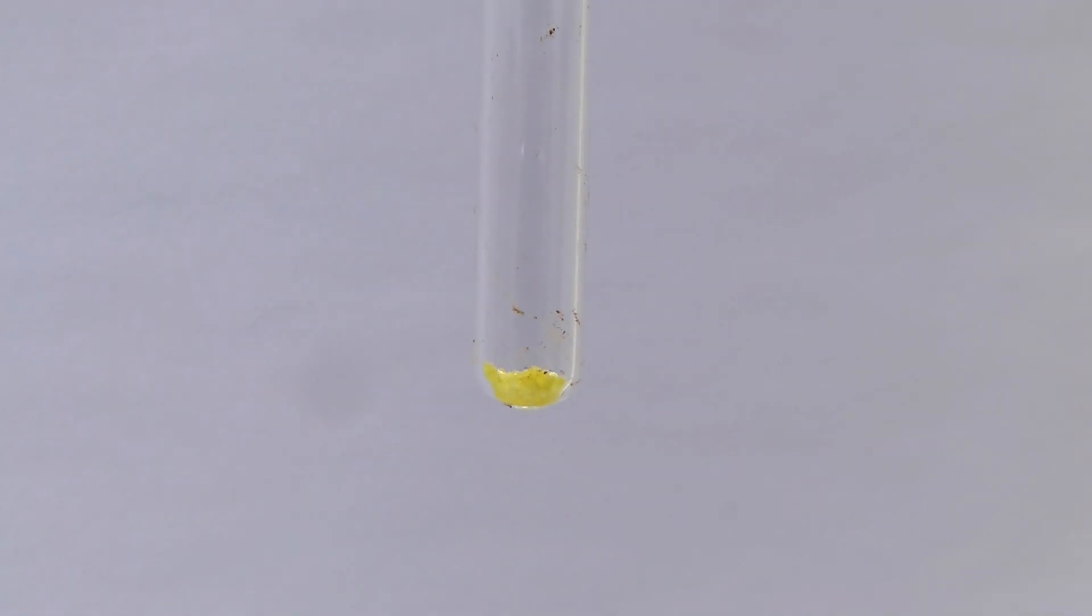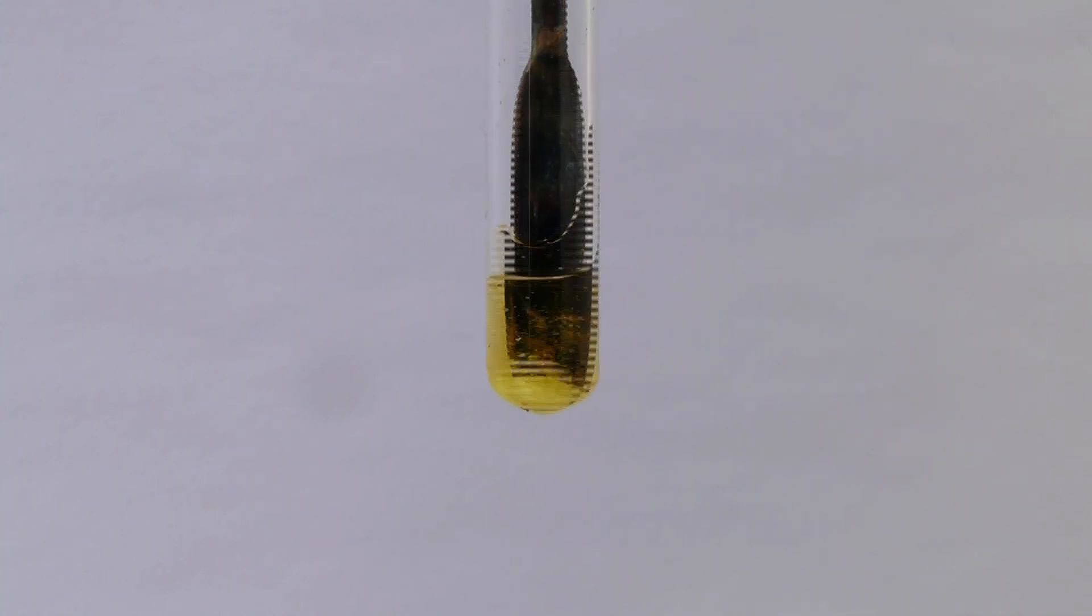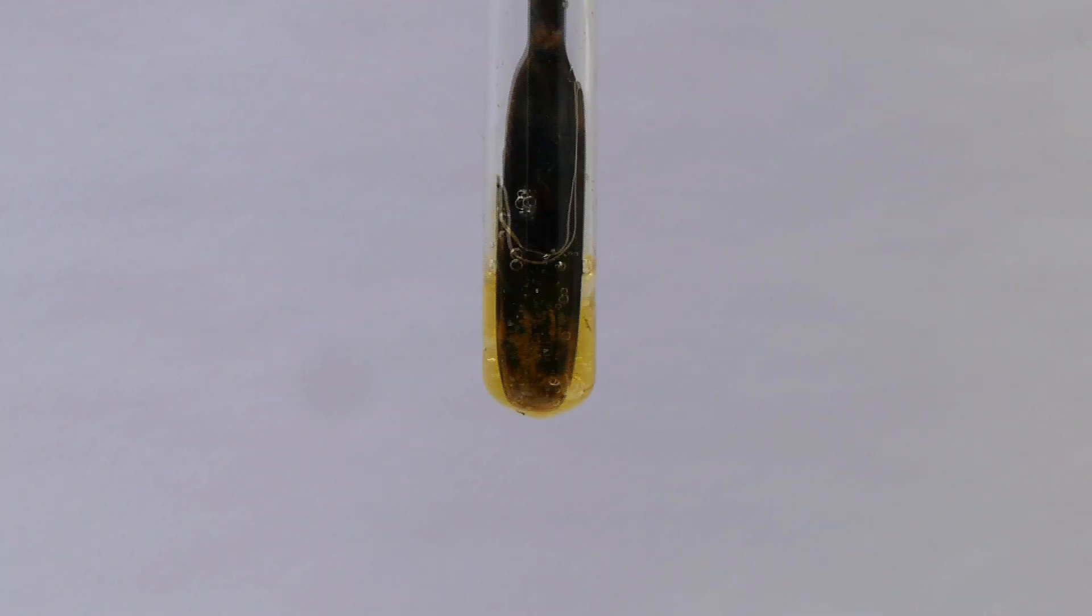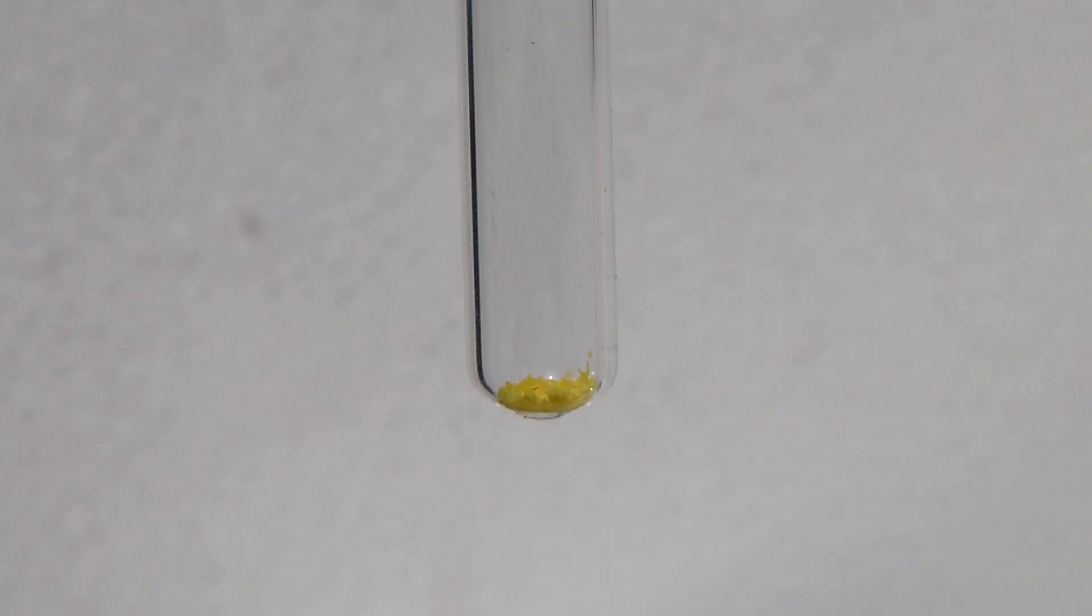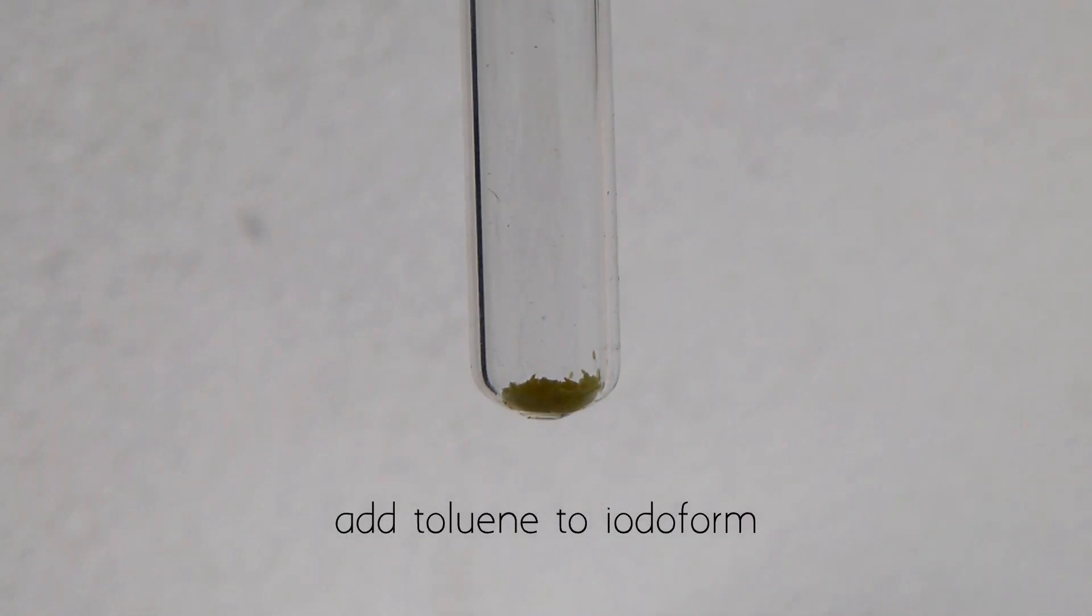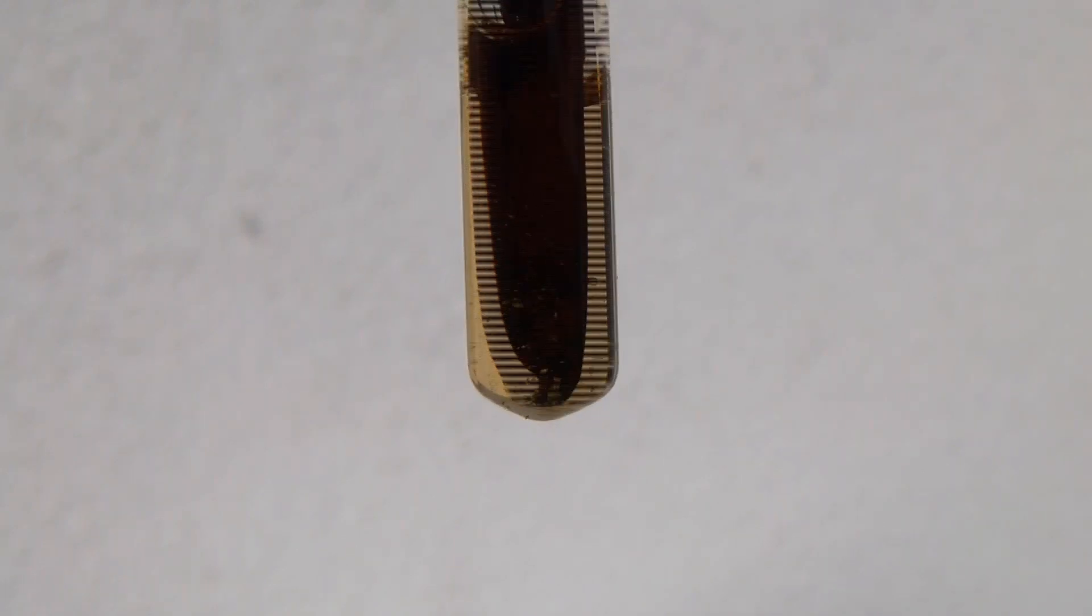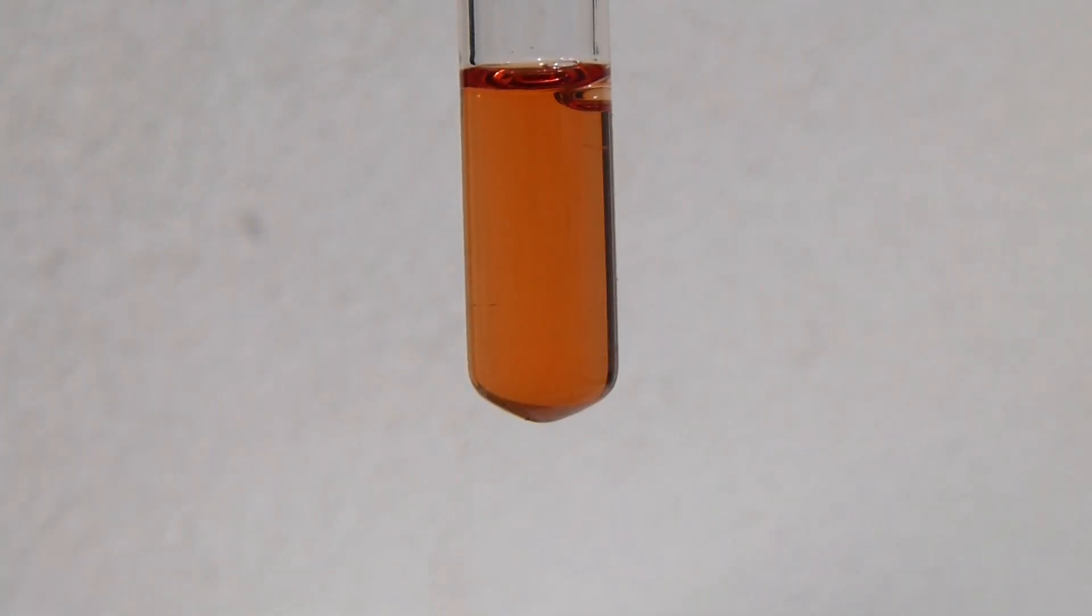As for solubility, it is pretty good in organic solvents, like acetone. You can see it forms this really nice yellow solution. It also dissolves pretty well in toluene, but giving a rather red solution. Not sure why that is though.